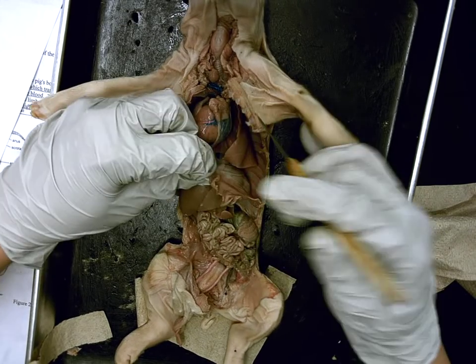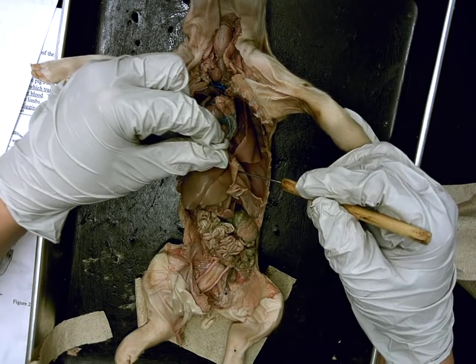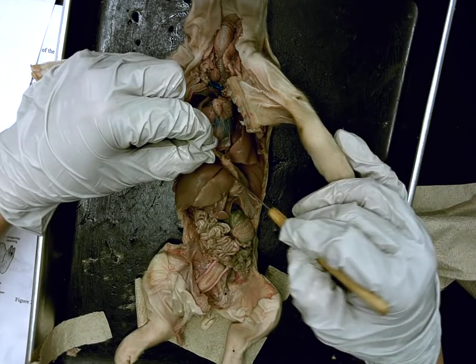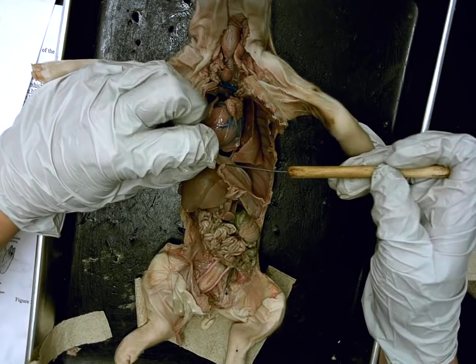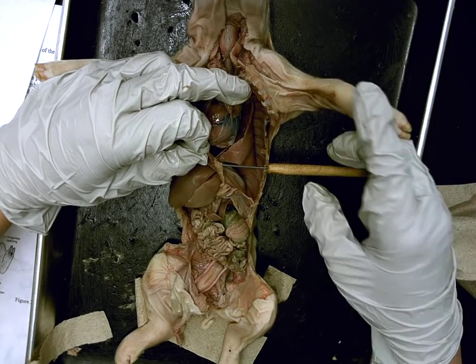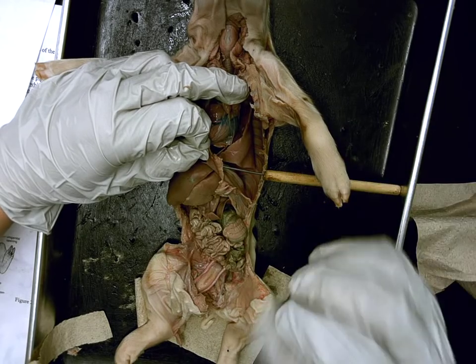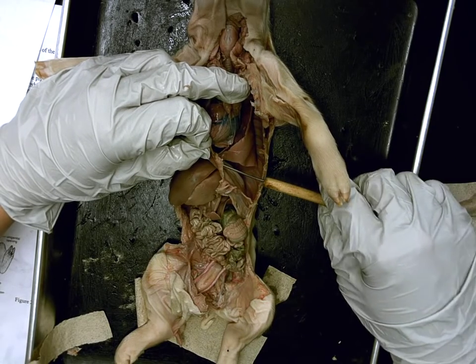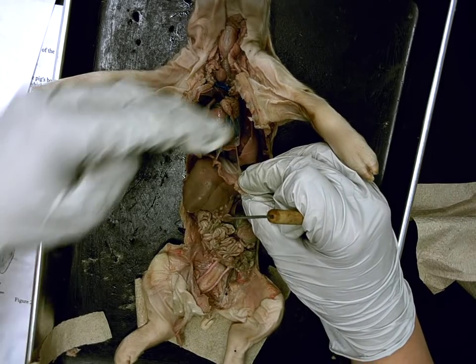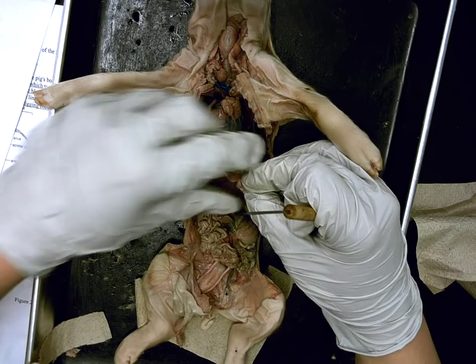Going back up, this big, huge membrane that was above the liver — Danielle? This huge flap of membrane, real thin. Diaphragm. Two functions. It allows air to enter and it shifts the air out of the lungs. Excellent. So it contracts to bring air in and out of the lungs. Second function — it was sealed onto the wall, which means it was separating the two cavities. Correct.